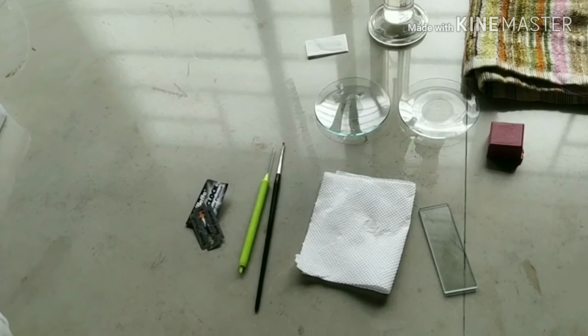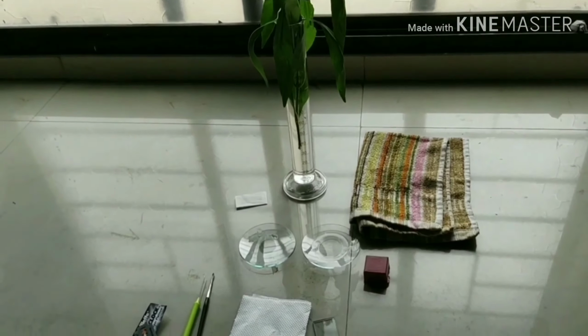The micromorphological studies are extremely important in the correct authentication of crude drug in pharmacognosy, since micromorphological characters are constant, consistent and characteristic and therefore provide a clue for characterization of crude drug. Section cutting is one of the methods of studying micromorphology.